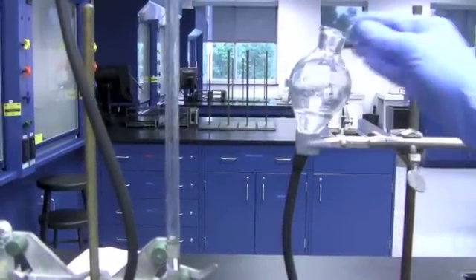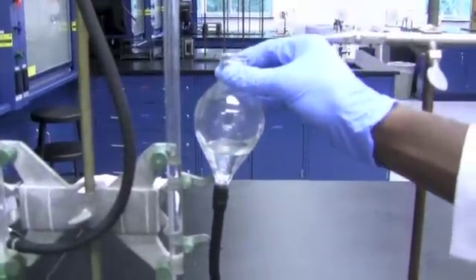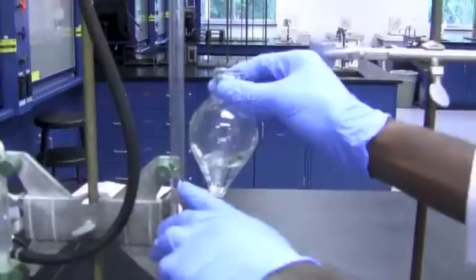The water levels in the buret and the bulb are now matched again, and the volume of the water remaining in the buret is read and recorded to two decimal places.